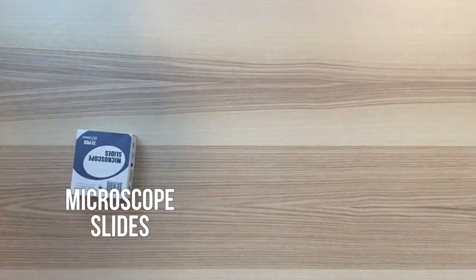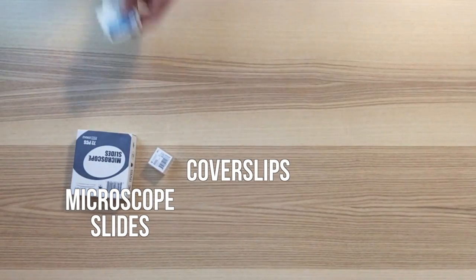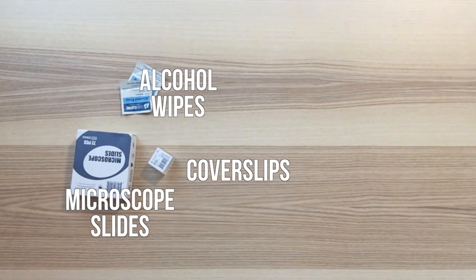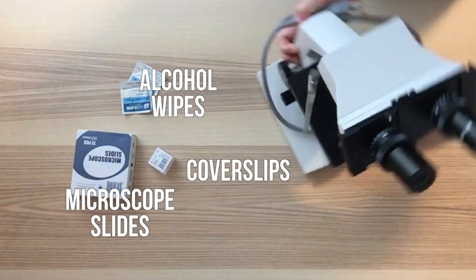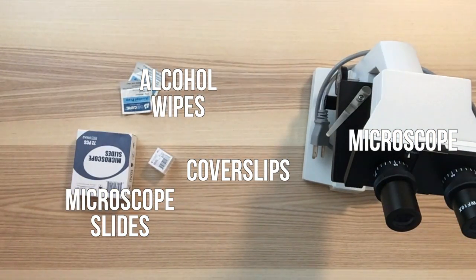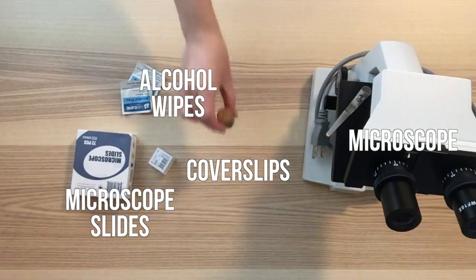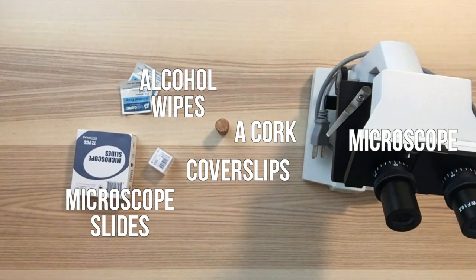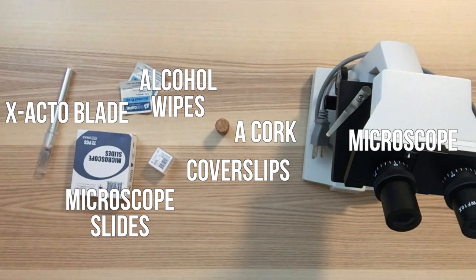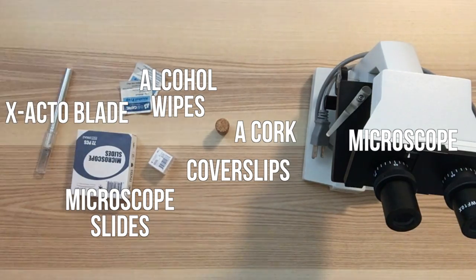You will need microscope slides, cover slips, alcohol wipes, a microscope, a cork, and an X-Acto blade.